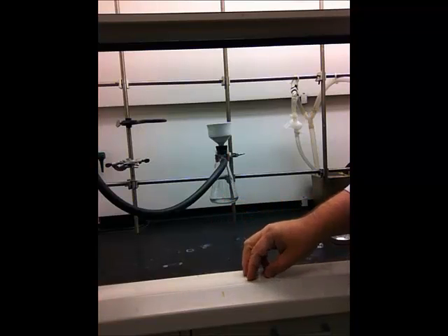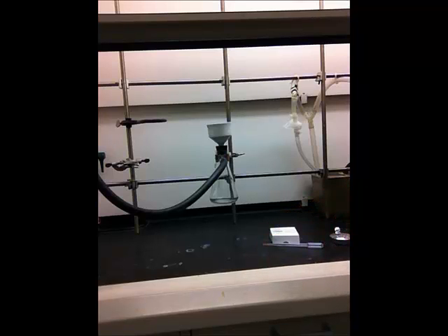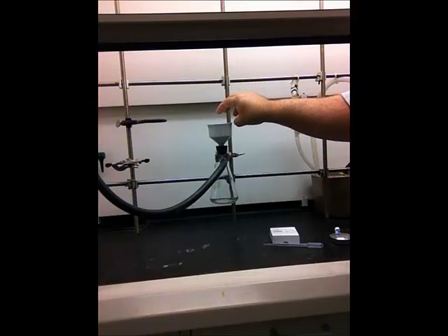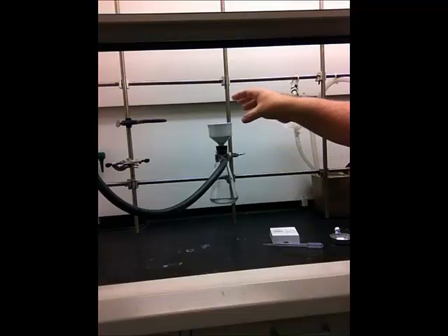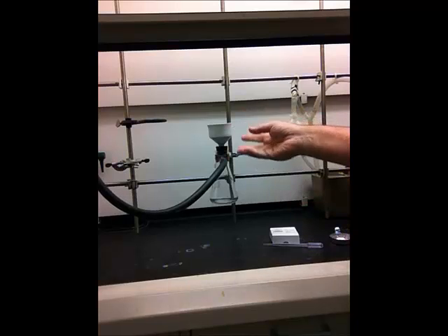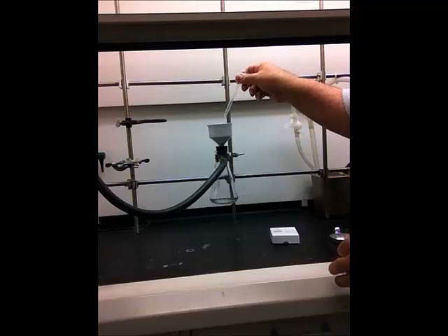So in general, if you're not sure which solvent to use, ask. But we like to wet the filter paper with whatever solvent the crystals are in. Once the apparatus is set up, wet the filter paper with a little bit of solvent, turn the vacuum on, and then pour in the solution of crystals. Use a spatula to scrape them down onto the filter paper if necessary.